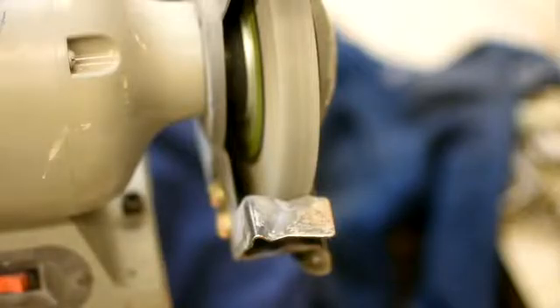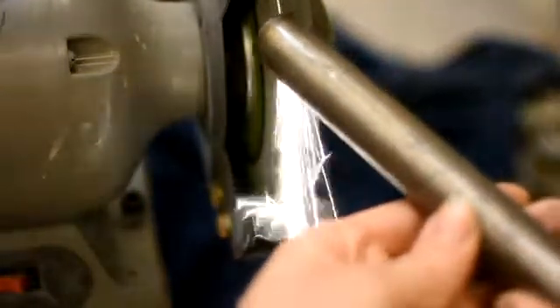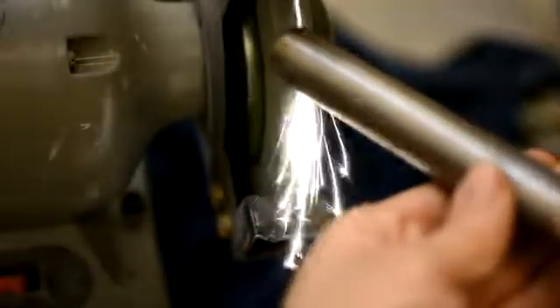To start with, we are going to be looking at titanium metal. One of the crude tests to determine if you have a piece of titanium metal is to run it on a grinding wheel. Running titanium metal on a grinding wheel will generate bright white sparks as the material oxidizes in air.